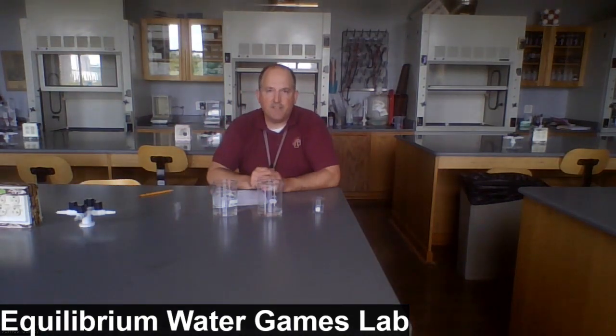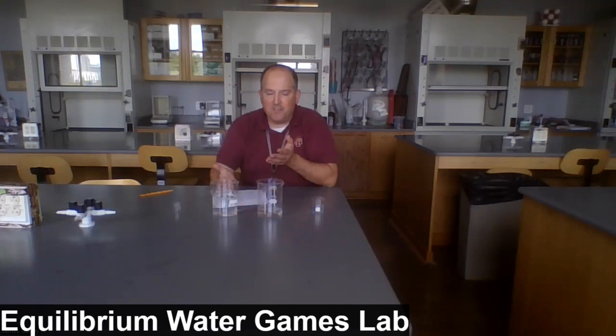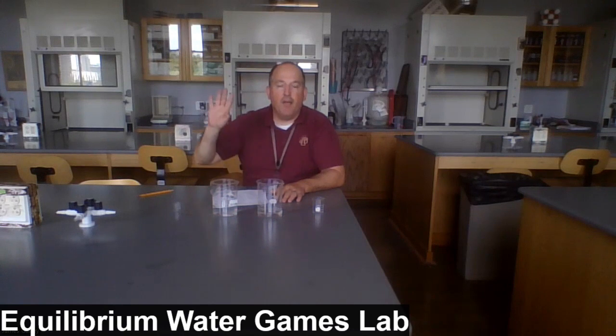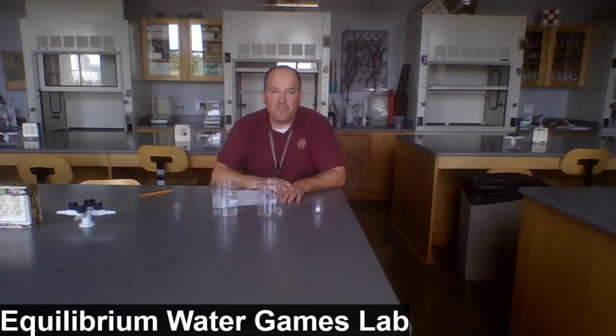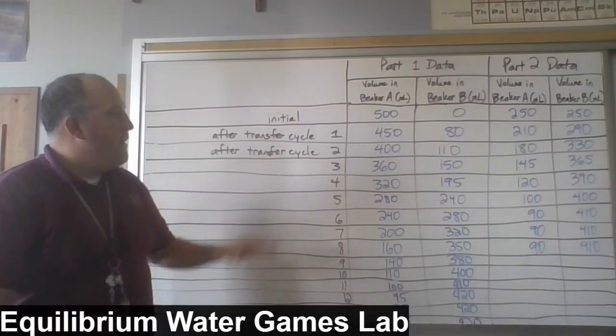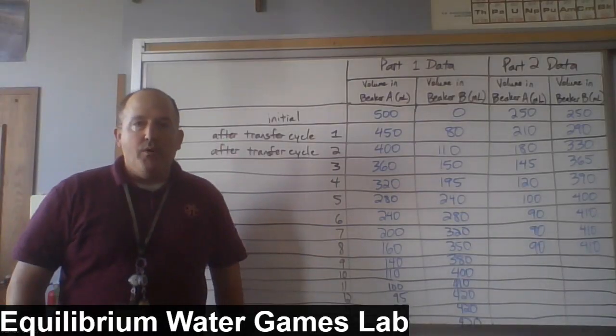You could keep doing this until the end of the day, and you'd still get roughly the same measurements of volume, 90 and 410. So let's stop here. I'll put the data table on the board so you can see it visually, and then we'll tackle the analysis questions. So here's a look at our data written out on the board.